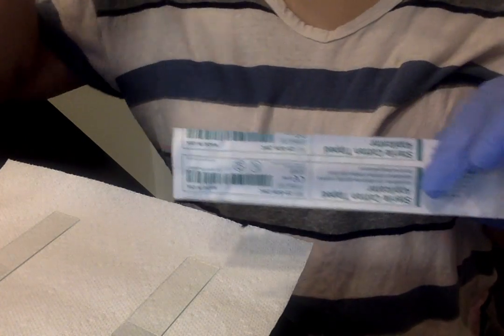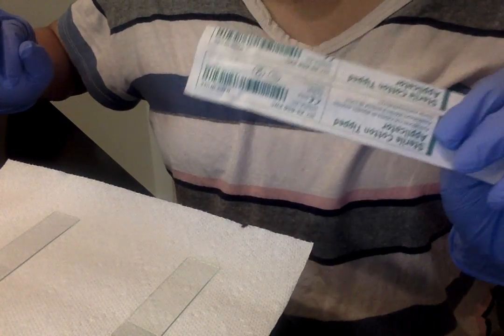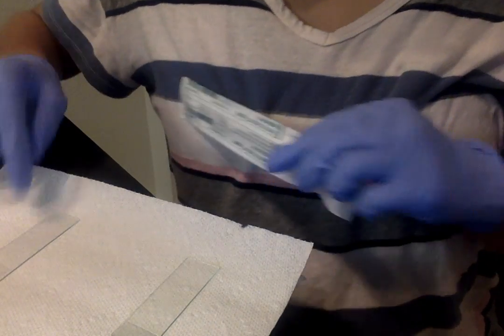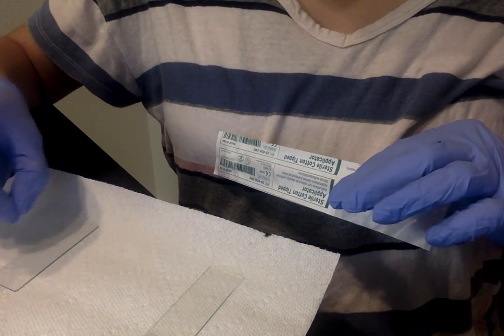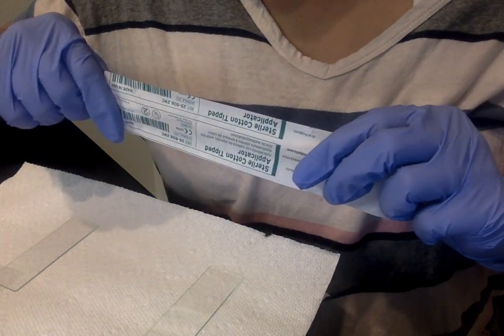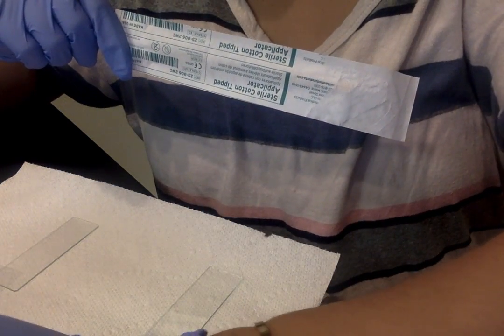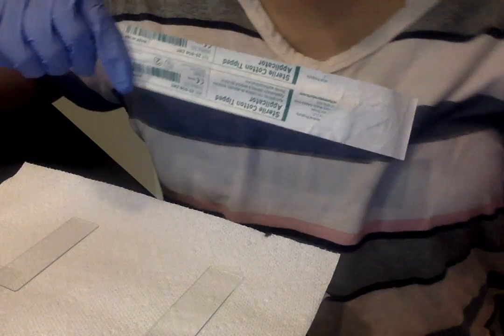I'll take the other swab and do the same, but for my dental plaque. That's going to go against my teeth and my gum line. Same thing — I'm going to smear it, add one drop of distilled water, and cover it. That's going to be my experiment for exercise three. After that, I'm just going to view the cells under scanning power and record my results.